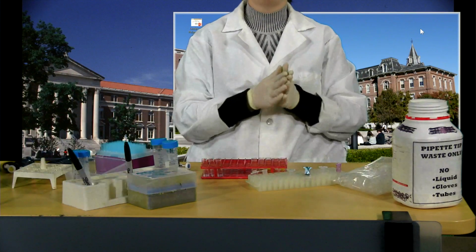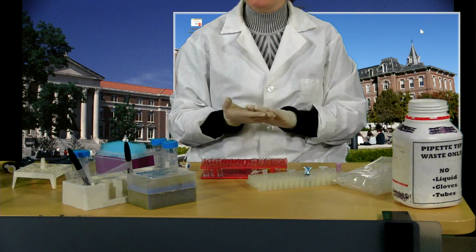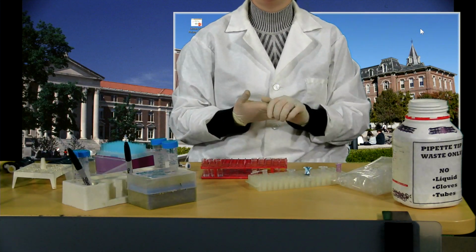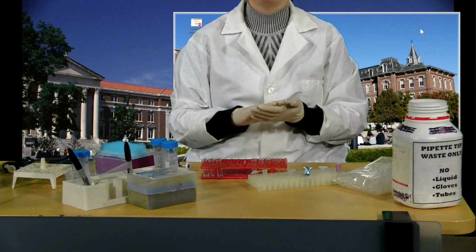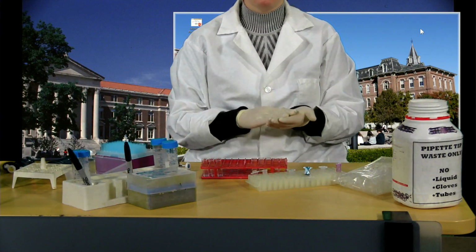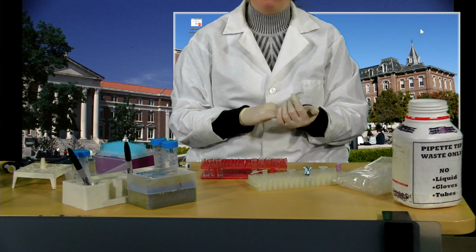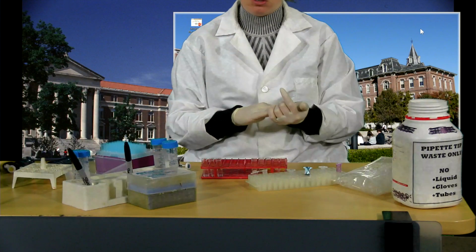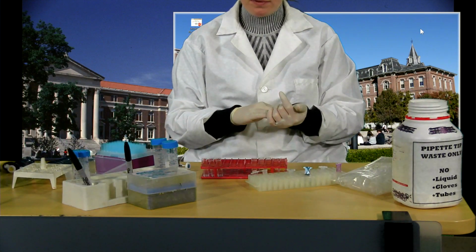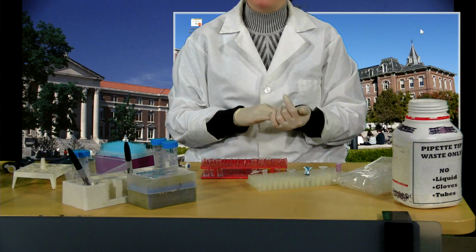Now, I'm not going to go through how to set up your spectrophotometer and all that fun stuff. It is the exact same as the way that we talked about it for the Bradford assay. You're going to calibrate with your blank, and you're going to configure with one of your samples here. This is not going to take near as much time, however, because of course we don't have a standard curve here. We're going to determine concentration using Beer's law. So again, make sure that you review your directions for instructions on how to do that. That's going to be pretty much it.